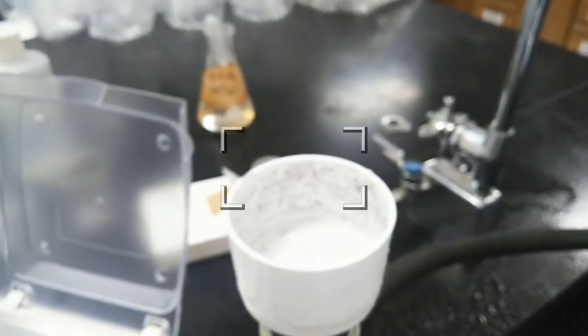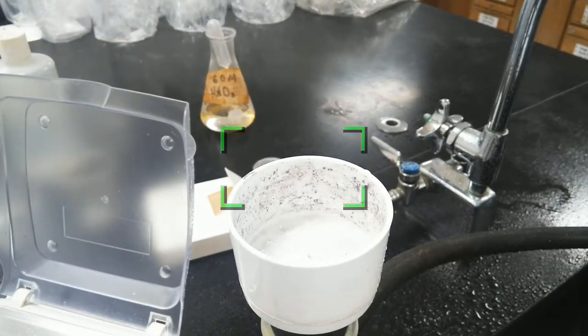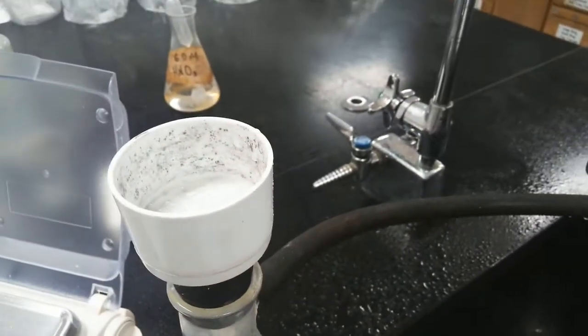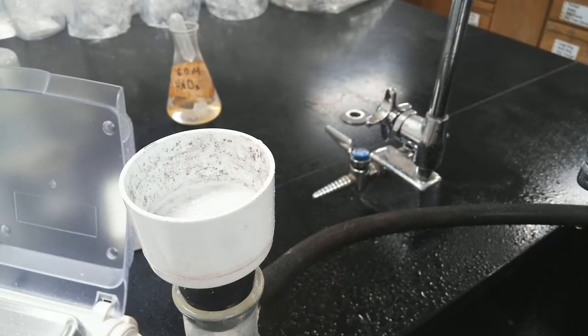So now we turn it off and you make a huge mess. There's water all over the table, but that's fine. It's water. Okay, then we're going to get a piece of paper towel. Just like last year, we need to get this thing out. And so you have to be like a surgeon. Oh, let's see if we can use this.